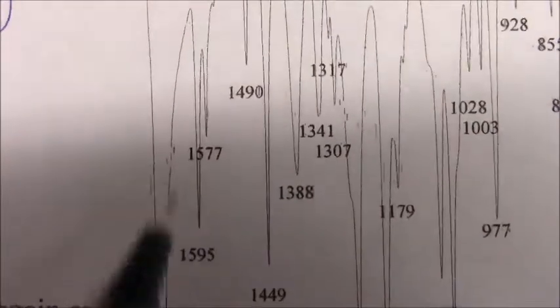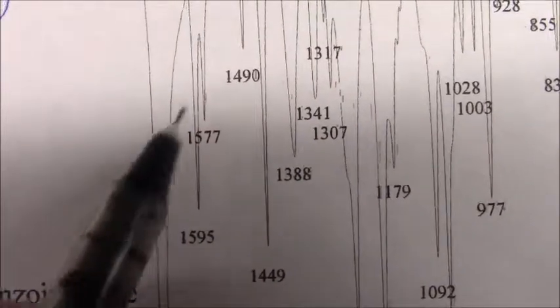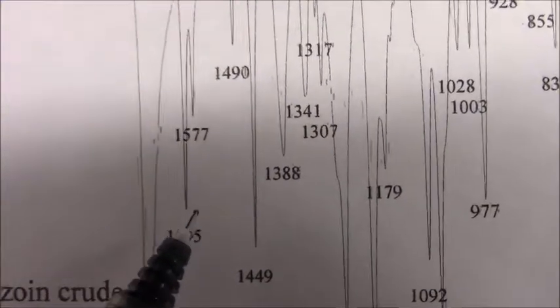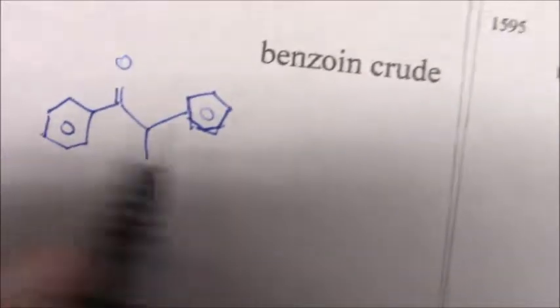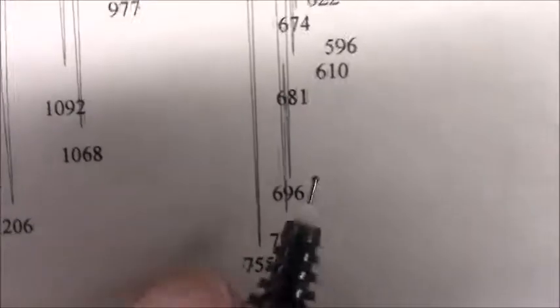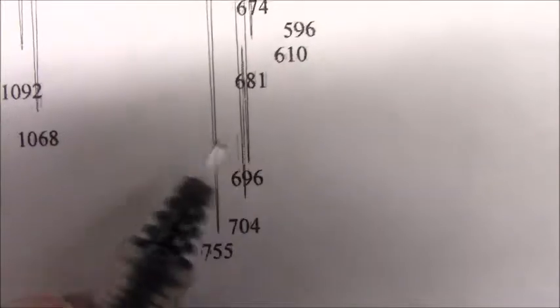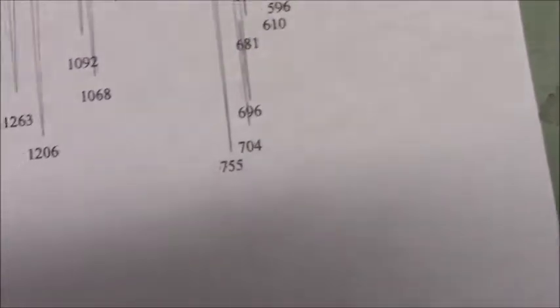The classic aromatic ring signature is something just like your Pavia book will normally circle, 3 sort of peaks, and call it aromatic ring carbon double bond carbon stretch. If you had a molecule with just carbon double bonds, you'd see stretches here as well. The only other thing I would look at is the mono-substituted pattern. You've got 2 mono-substituted rings, so you might see a little extra duplication. This one, 755, both of those rings have it. So you could arguably circle this and just call it mono-substituted OOP bend of an aromatic ring.